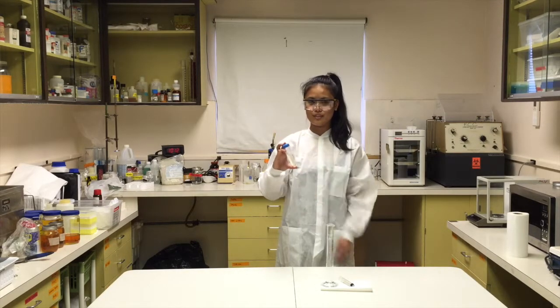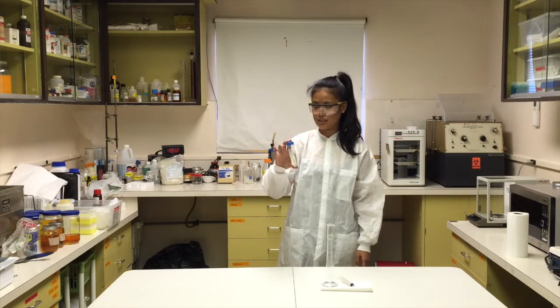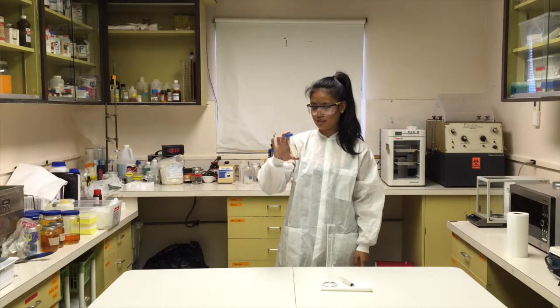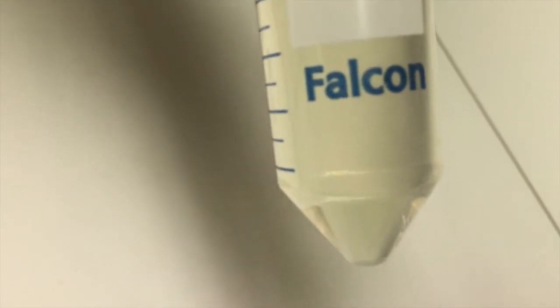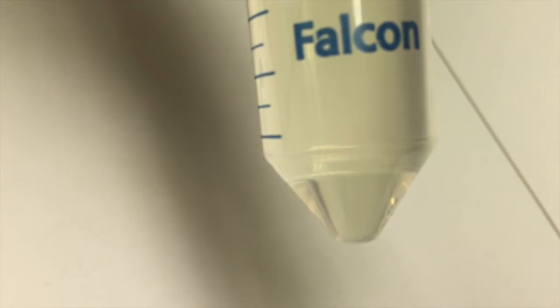Now we're going to invert this about 2-3 times. So we want this to settle for about 10-15 minutes to get the results.